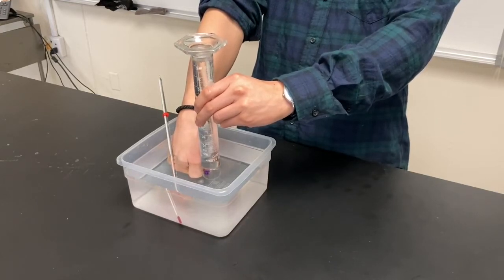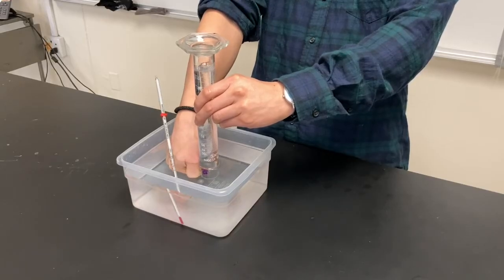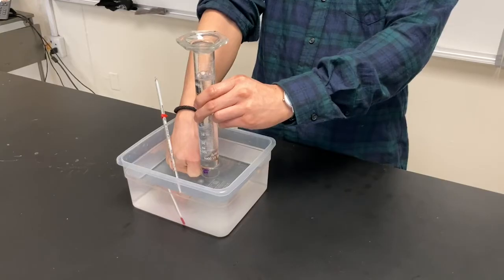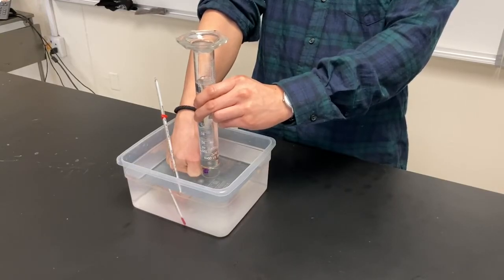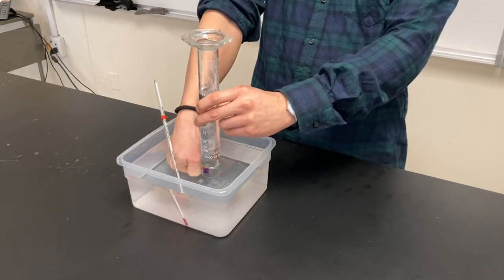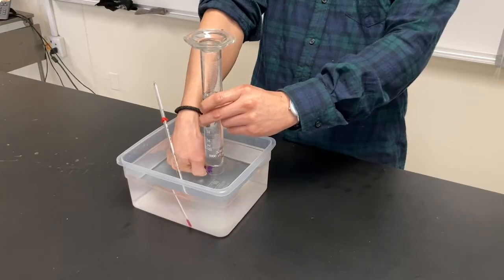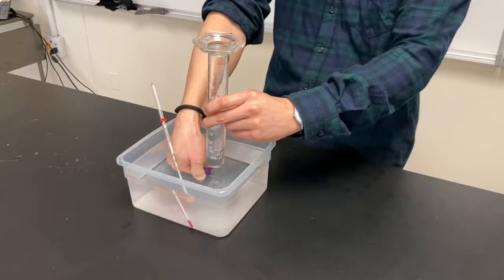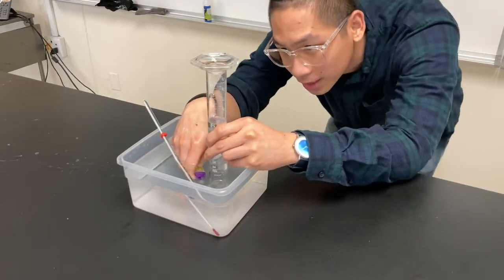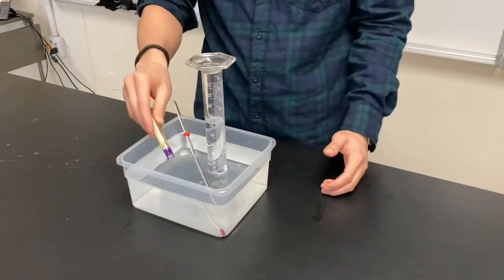As I press the button, the butane rises to the top because of density. I'm going to collect about 50 milliliters — I'll give the exact number once I've collected it. Another error that could happen is if the butane gas doesn't go inside the cylinder, then I've lost some of that butane. I've got 50 milliliters here.